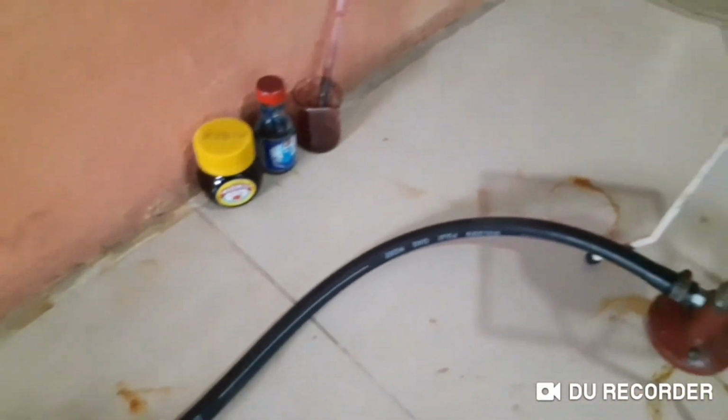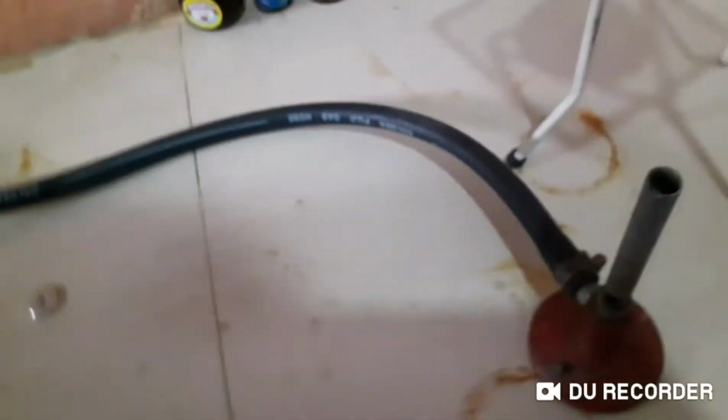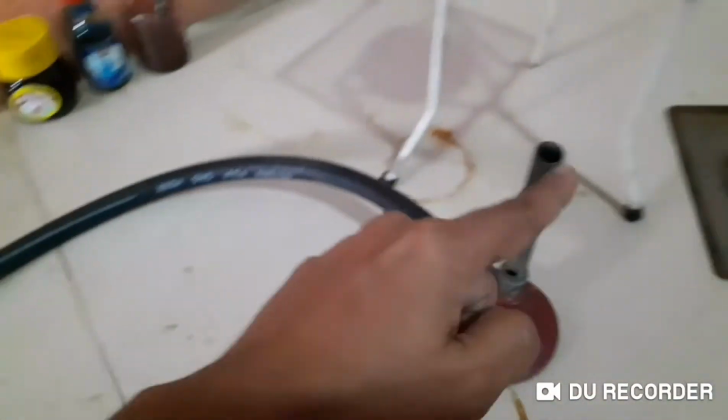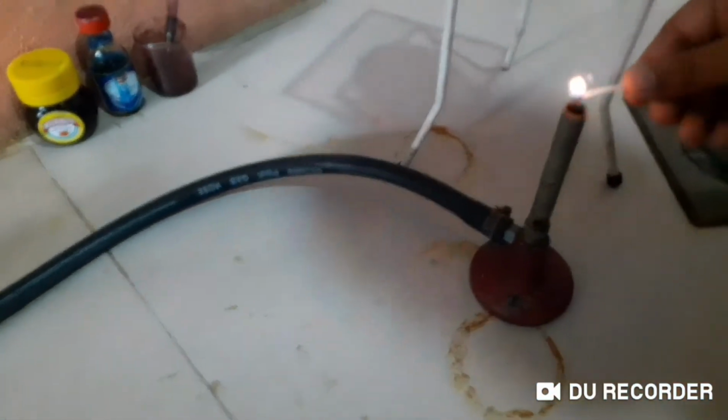Someone has to do that. Okay, we have the tongs here, right? Yeah, let's see, can someone light up? Okay, a boy can come here, help me. Boys, light up, right, wait. You know how to light up, right? Yeah, you come here, you have to hold it near this part, okay? Only your hand, right? I can't go there because of my face. No, you come here from this side. Okay. Okay, take your hand off.